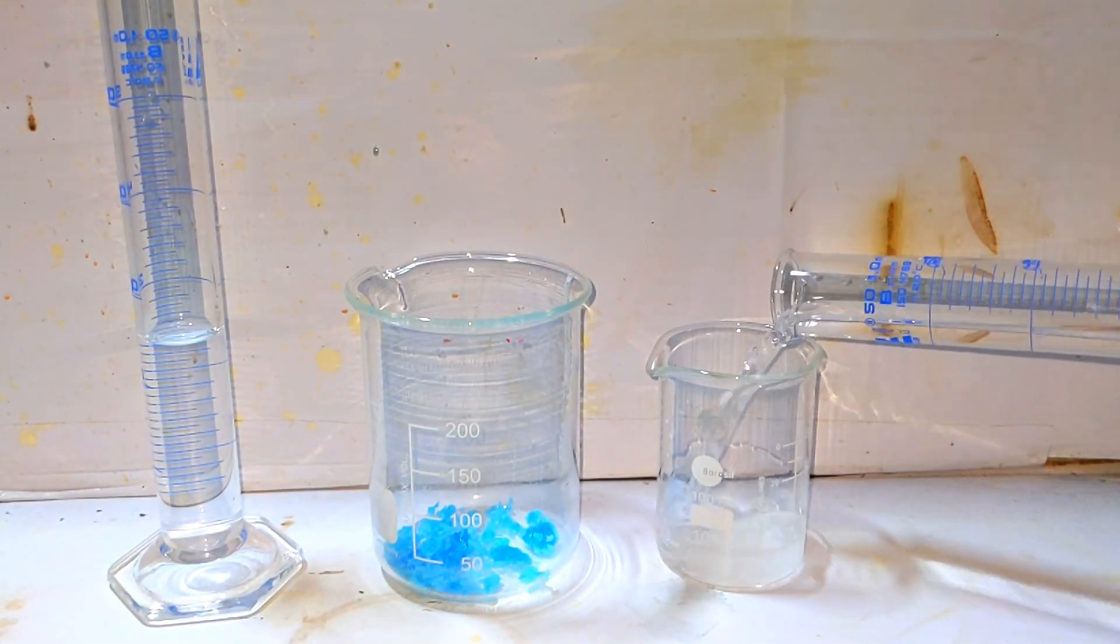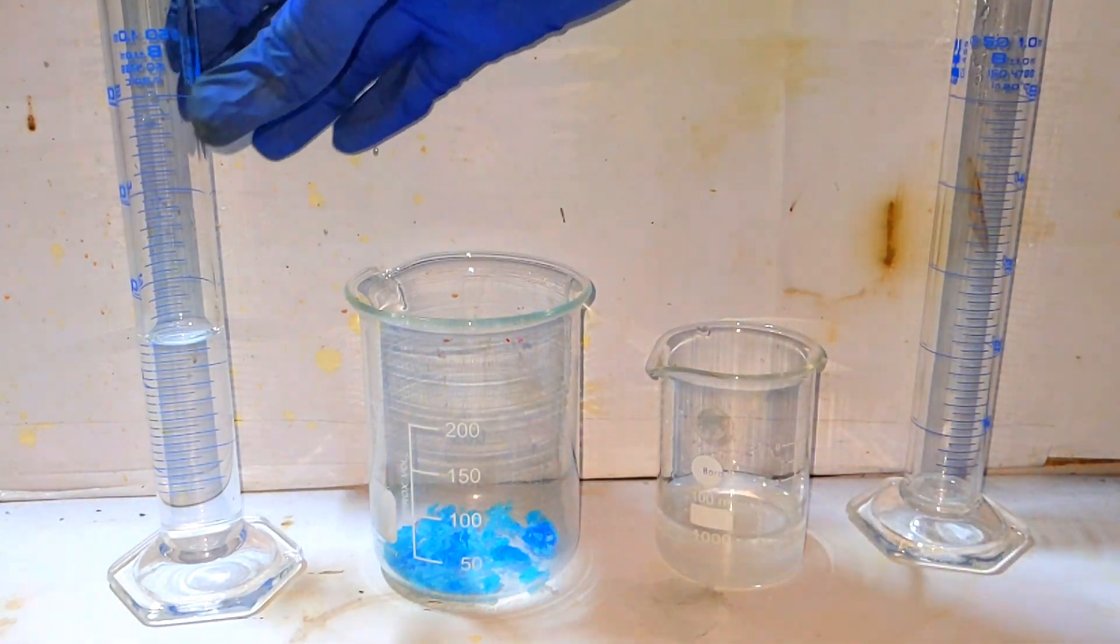25 milliliters of distilled water is added to both the salts to make up their solution.